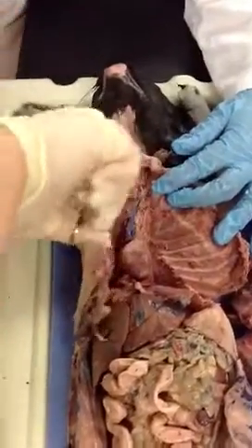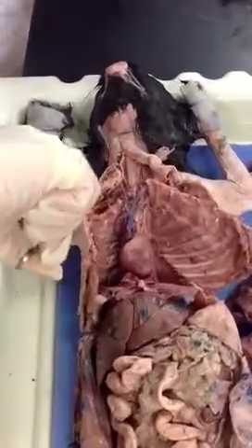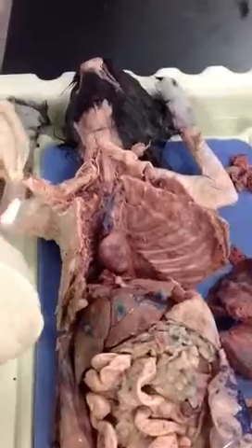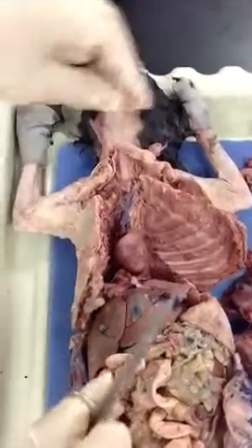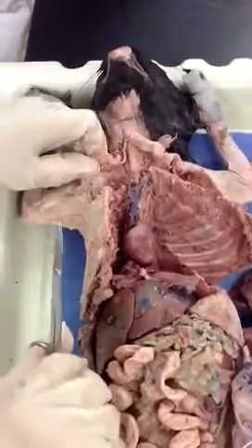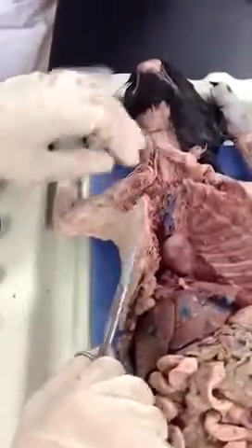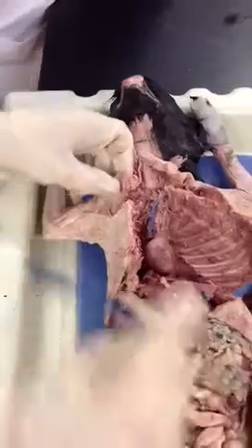Watch out. I'm going to cut that. But the four branches, the internal mammary, vertebral, costocervical, those come off of the right subclavian? Yeah. Not the left. The left one also gives me branches, but we're going to first start with the right one, and then we'll continue with the left.